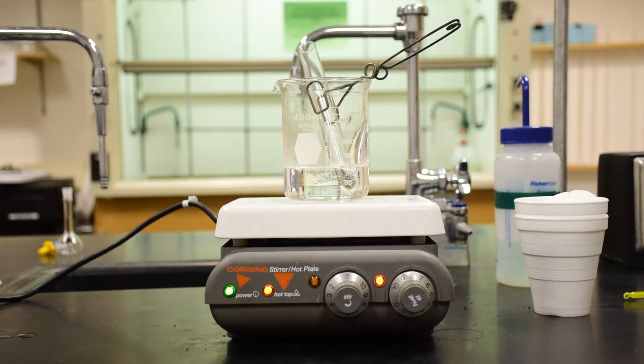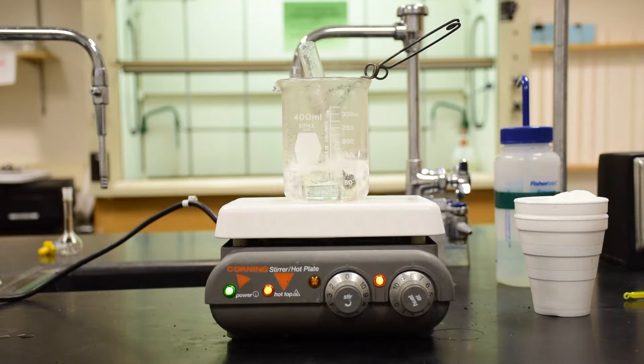If possible, balance the test tube just above the bottom of the beaker. You'll want to boil the water for 5 minutes to make sure that the metal is heated thoroughly.